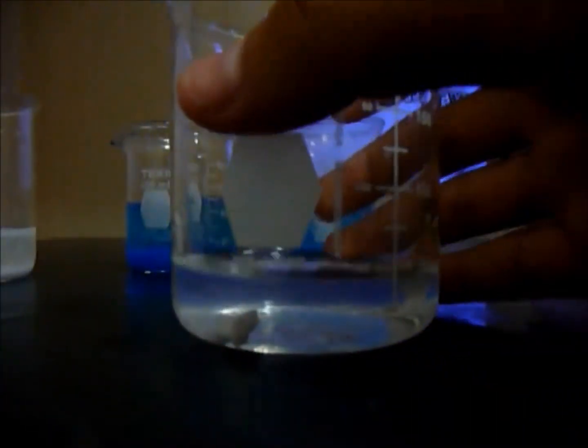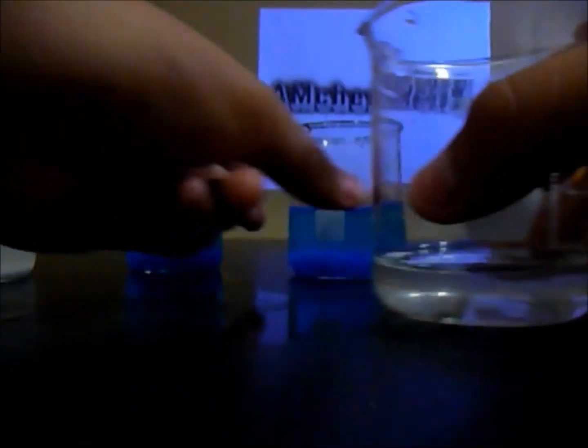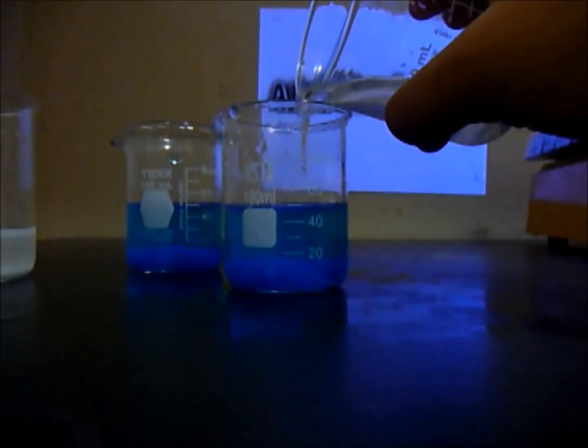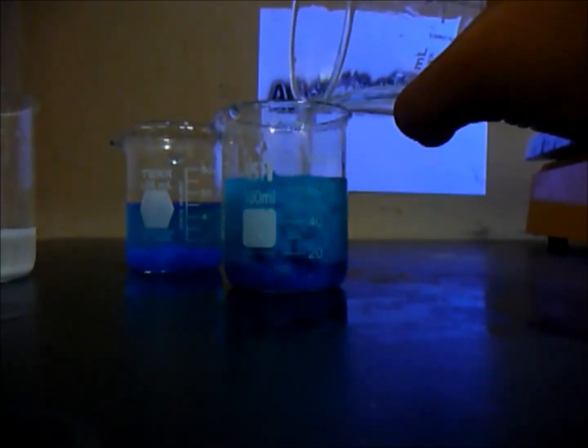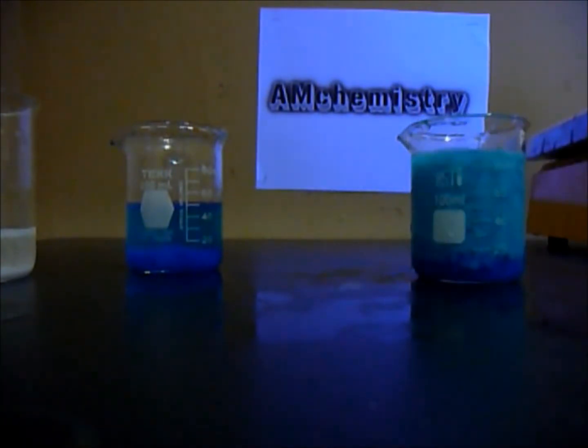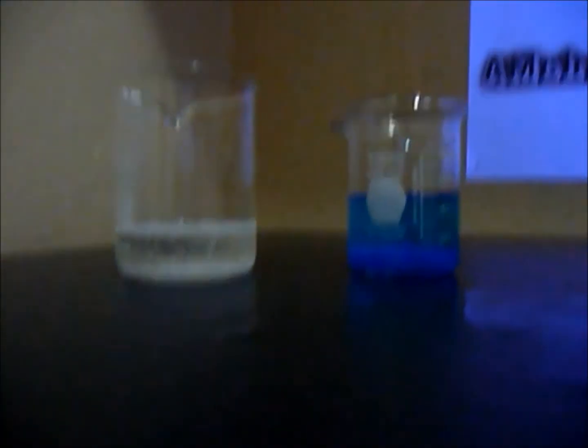So this is sodium carbonate, Na2CO3, and look what happens. It turns to copper carbonate without a lot of CO2 evolving with the reaction.